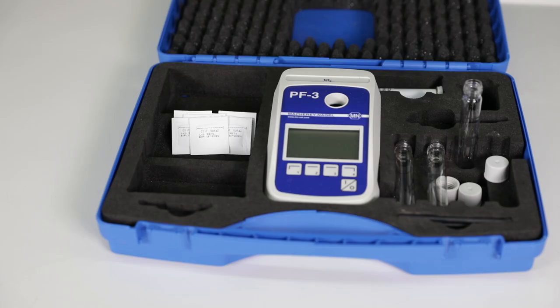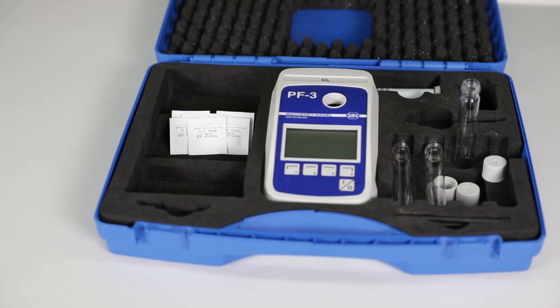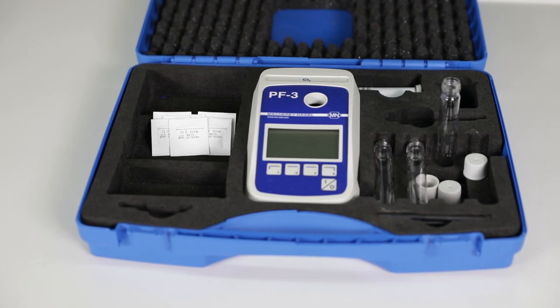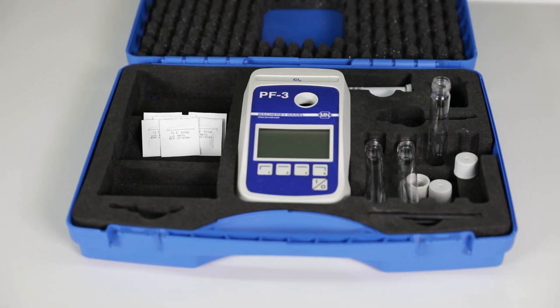A fundamental principle for the total chlorine calibration is the fact that the sensor remains in the process and a sample is taken out to be analyzed for the total chlorine concentration. Analyzing the total chlorine concentration of the sample is done offline with a colorimetric measurement according to the DPD method.